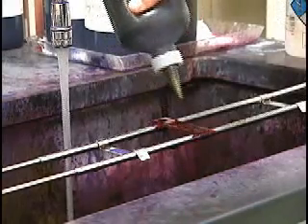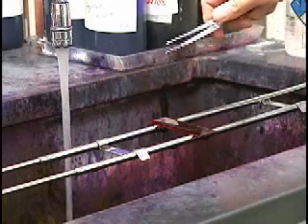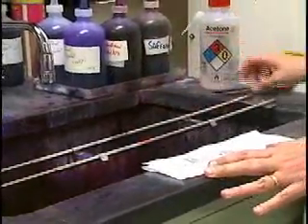Now we put on the counterstain, safranin, so that we can stain anything that was decolorized on the slide or had not already taken up the stain. This also stays on for 10 to 60 seconds and then is rinsed away, and then we dry it. Now we can look at it under the microscope and see if we can identify any organisms. This is the fundamental of the Gram stain — it's been around for 125 years and is still an amazingly powerful tool and the backbone of the Clinical Microbiology Laboratory.